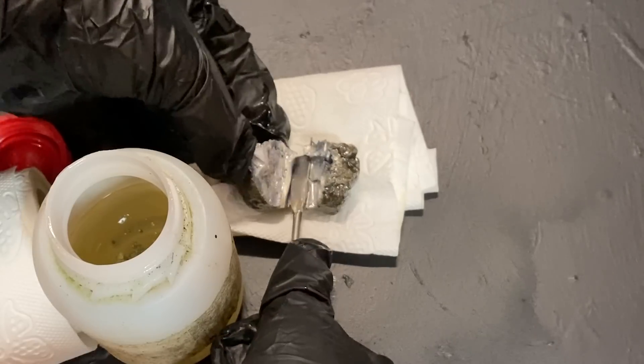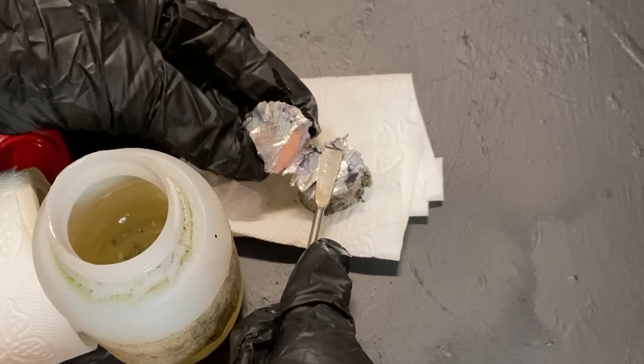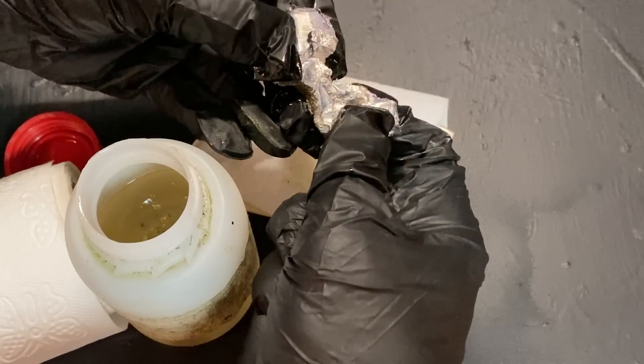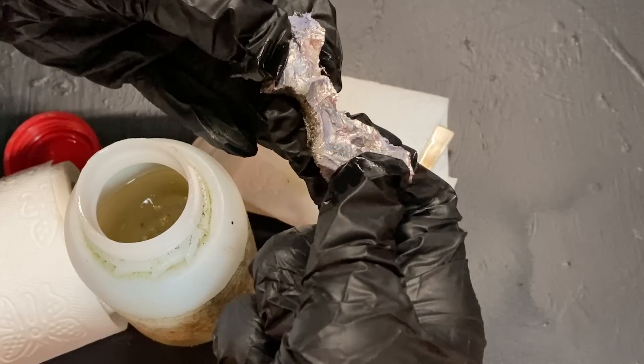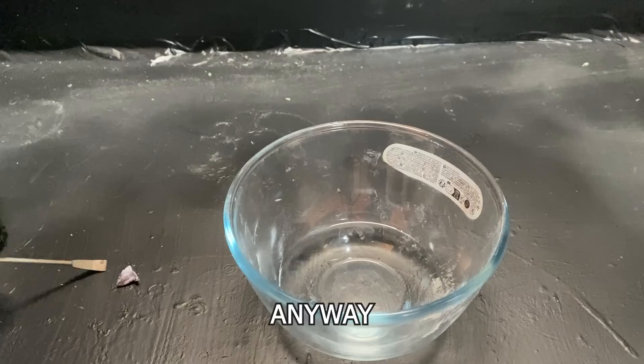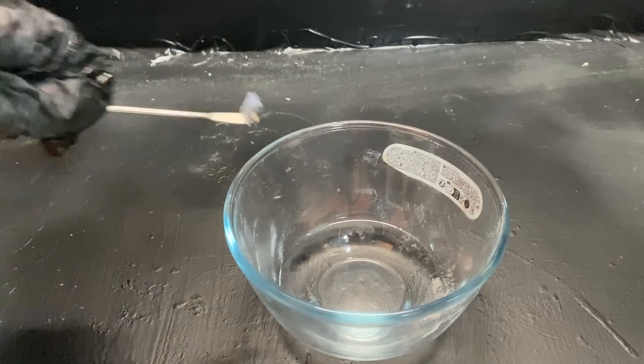What's even cooler about potassium is its soft and almost butter-like consistency, and I can pull it apart using minimal force in my fingers and kind of looks like metallic nutella. Anyway, this is getting too educational, check this out!